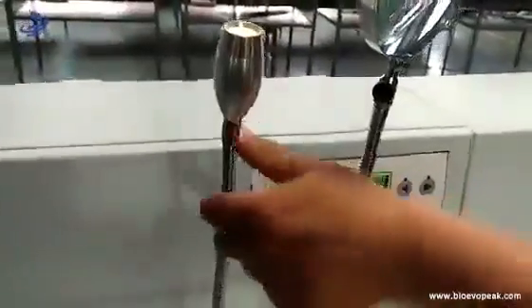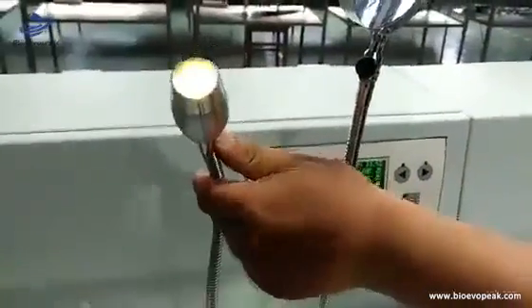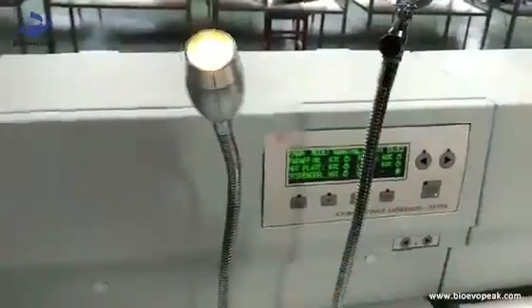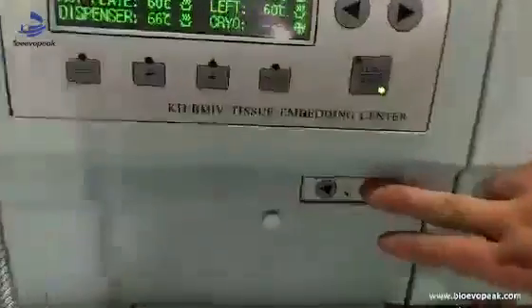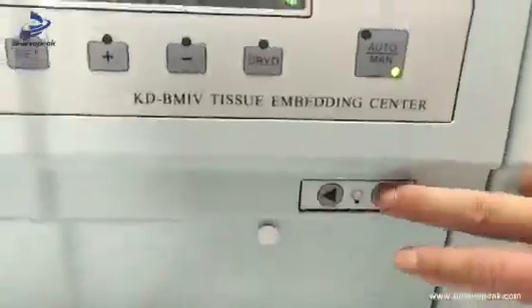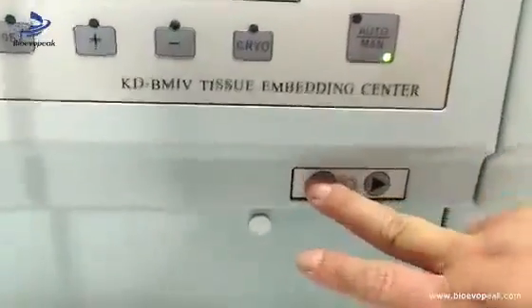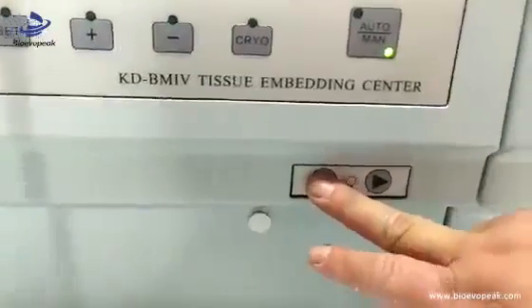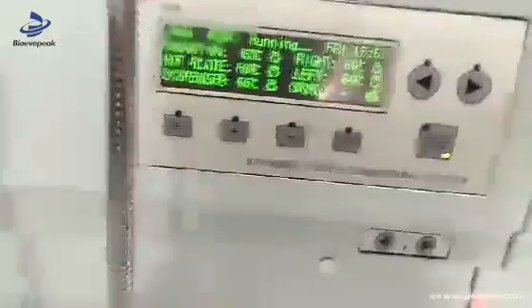This is the light for the machine. We can adjust the brightness for the light by pressing these two keys. Press this key to make the light brighter, and press this key to make it less bright.